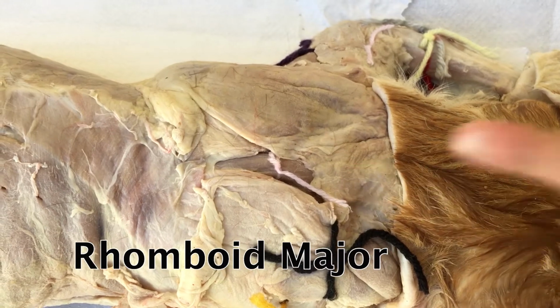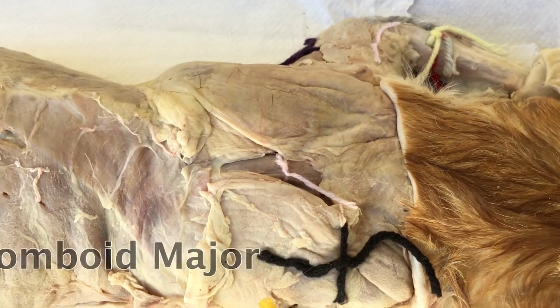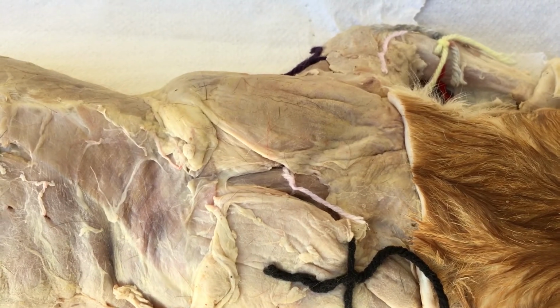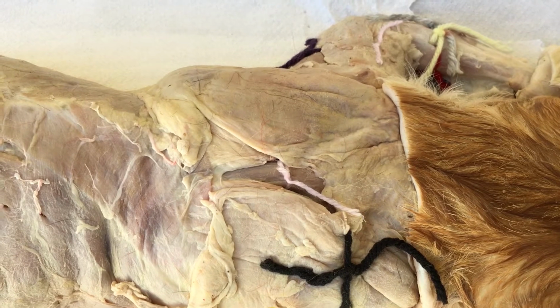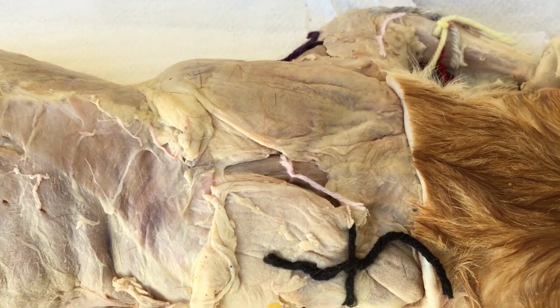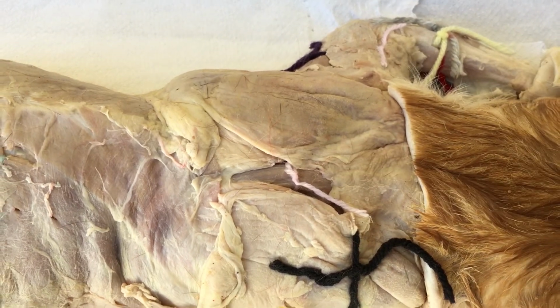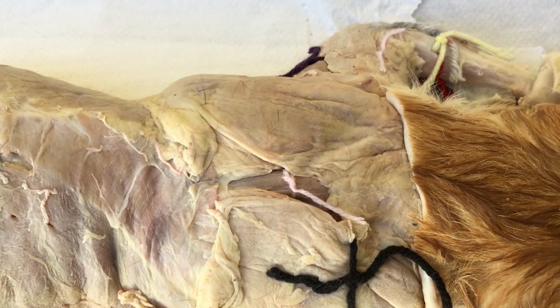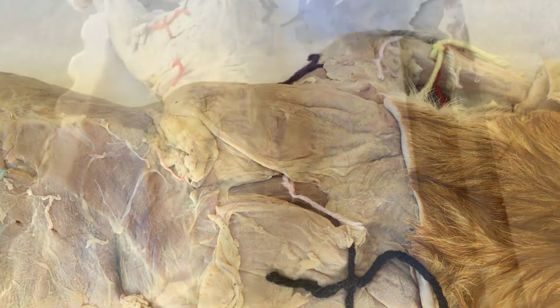This is the rhomboid major. It is located in between both scapulas. The action of the rhomboid is to retract the scapula. The origin of this muscle is the thoracic aspect of the vertebrae, and its insertion is the border of the scapula. The fibers of this muscle run parallel along each other. A way to remember this muscle is that both the major and minor form a diamond shape, which is the same as the shape of a rhomboid.